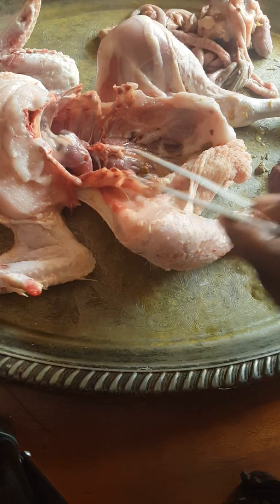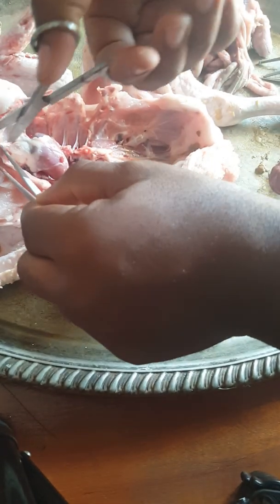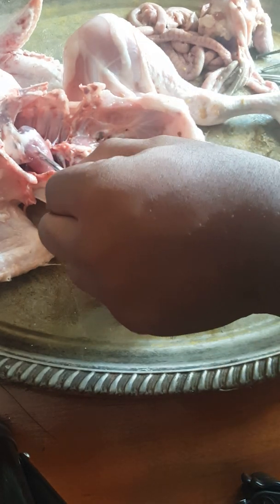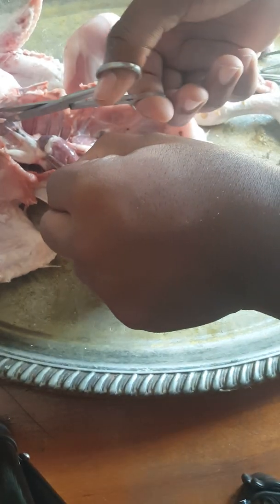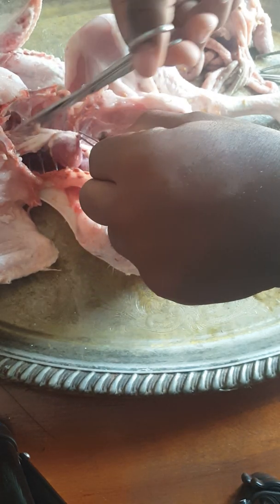So now here is the heart. Okay. To see the heart very well, it's important to remove the visceral pericardium, but it's as if it's already removed. Now, we can see the heart here. When I'm trying to pull the heart outward, I see some major vessels here. If I cut here, this is a certain fascia. I can remove this fascia all above here.